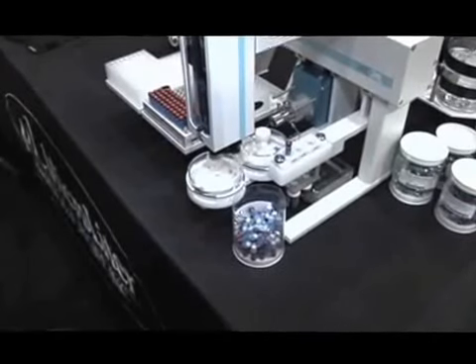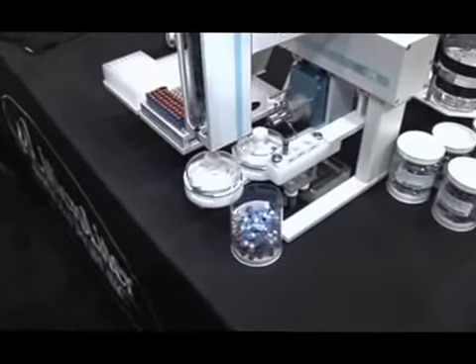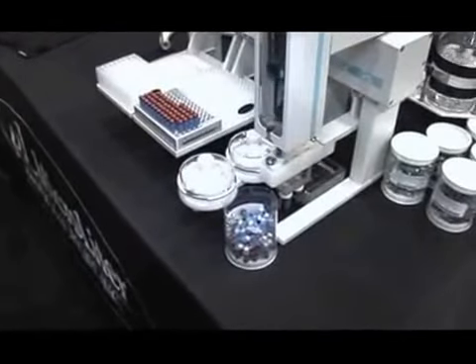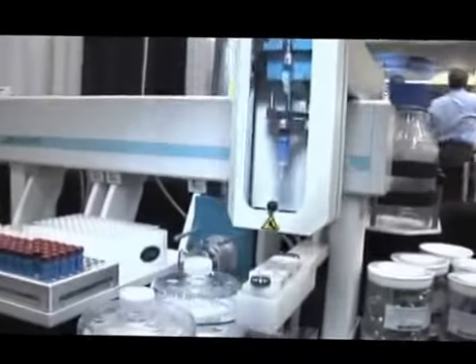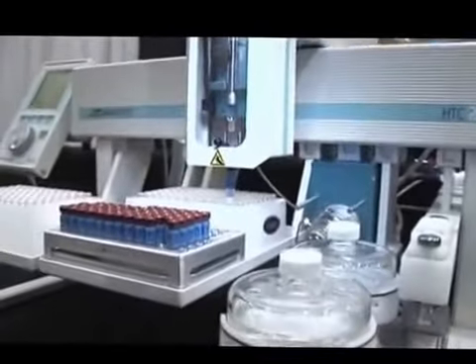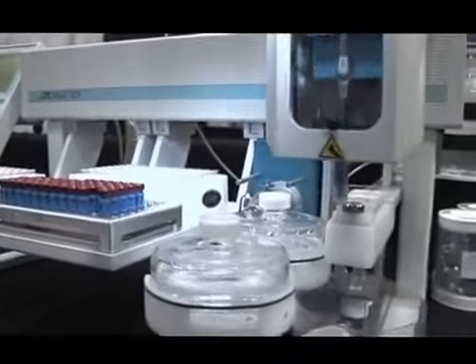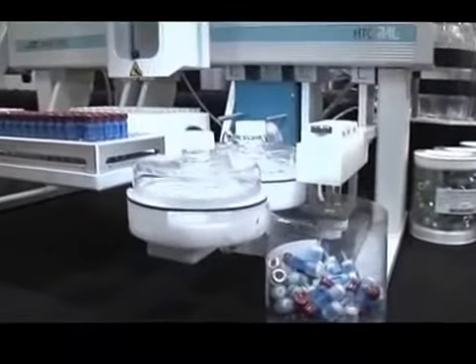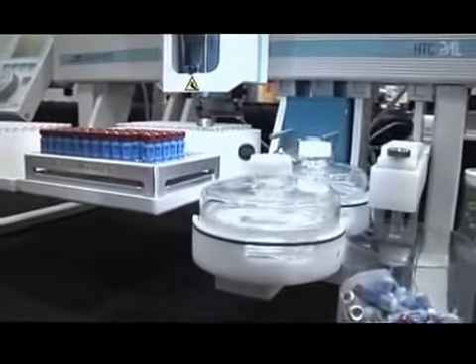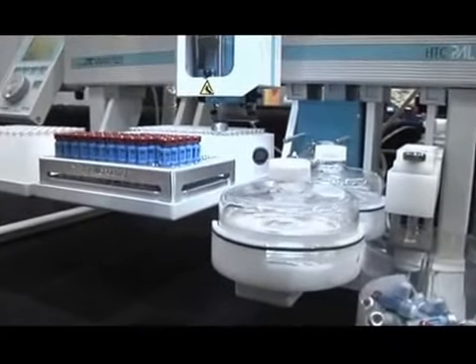We see generally solvent reductions of 70%. The labor is obviously non-existent except for prep of the actual supernatant if you need to do that. We found urine to be a great platform. Blood and plasma and serum has to be cleaned up before we can use it. It's good for any kind of water analysis, things of that sort. QA, QC of raw material and finished goods is another application.